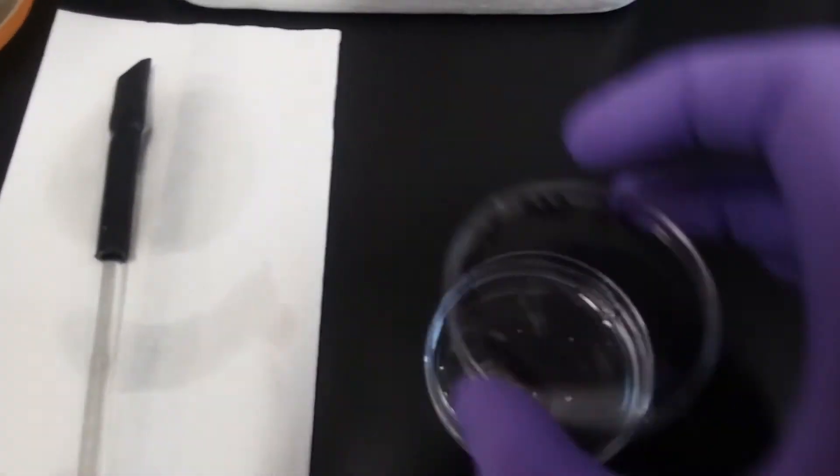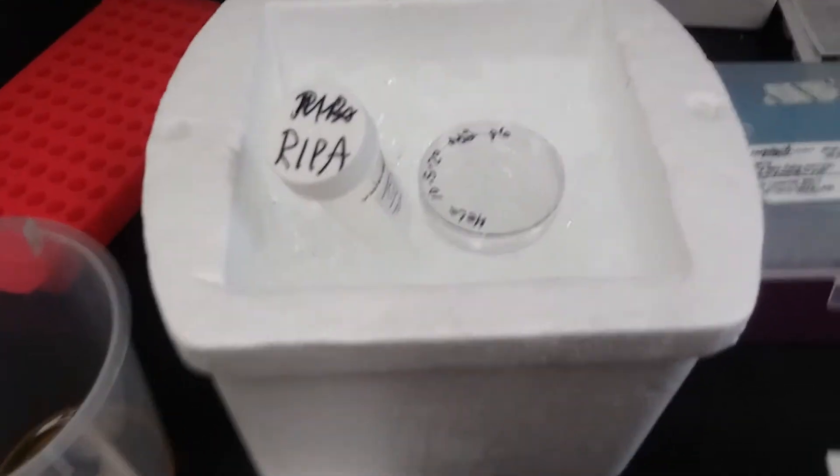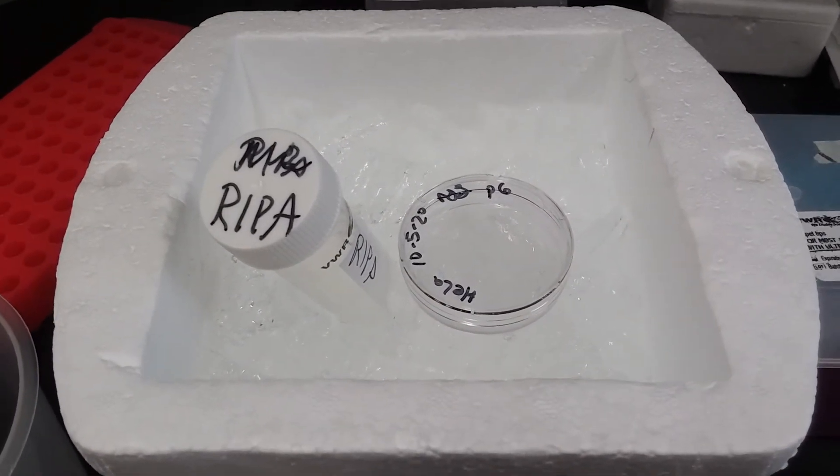So on to the ice, five more minutes. By that time, there'll be nothing left on the plate to see in the microscope, and we're just going to harvest the whole cell lysate.